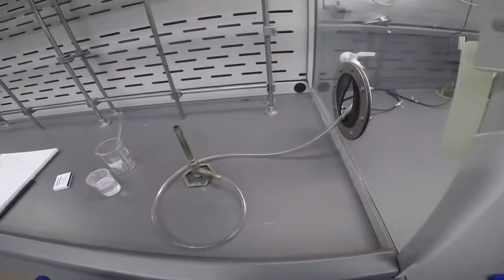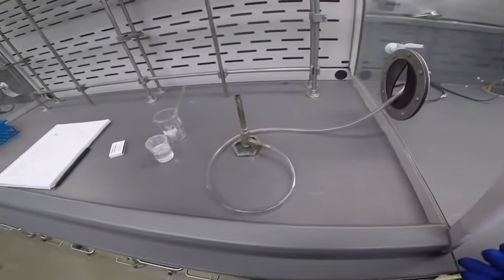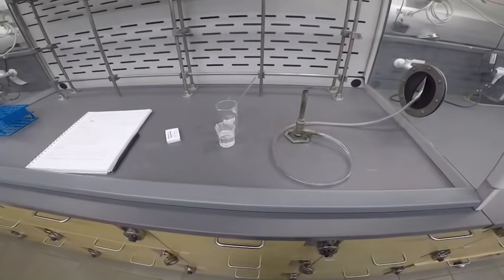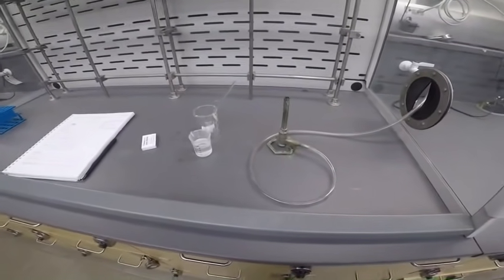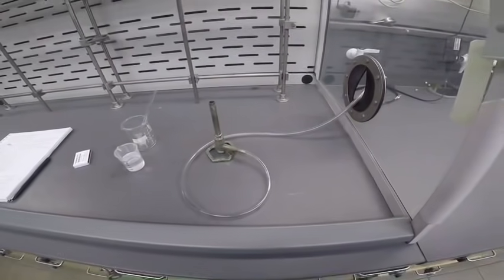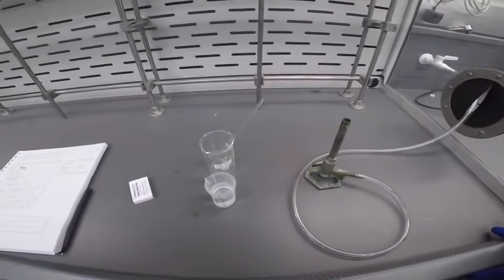Okay, so there's a unique test that we could do, adding particular reagents. The reagents you want to think about adding are things like sodium hydroxide. You can add sodium carbonate. You can add sodium sulfate. There are also some flame tests that you can do. So we're going to do one now, and there are 2 ions that can be detected with a flame test.